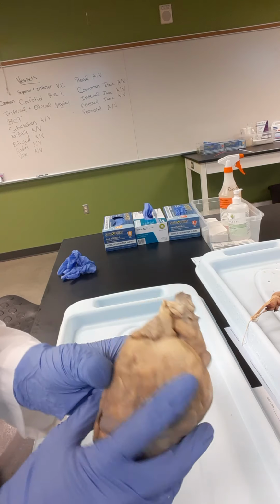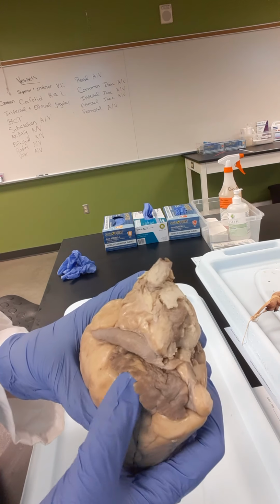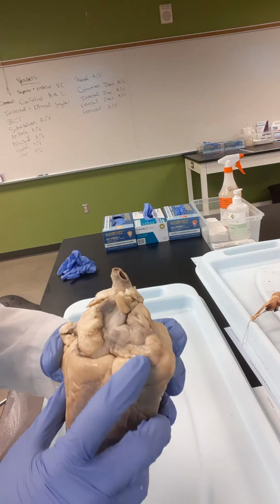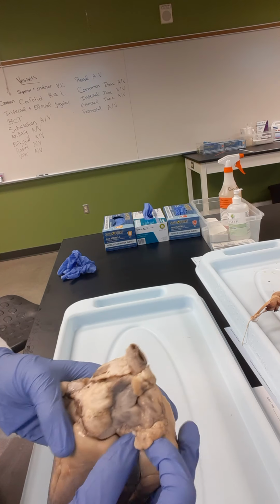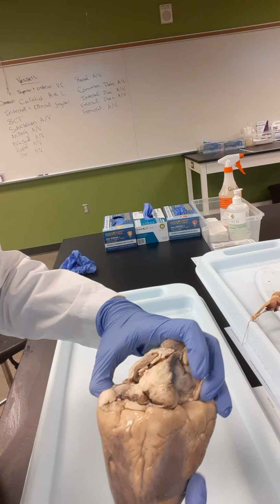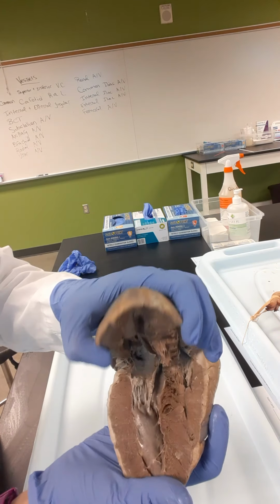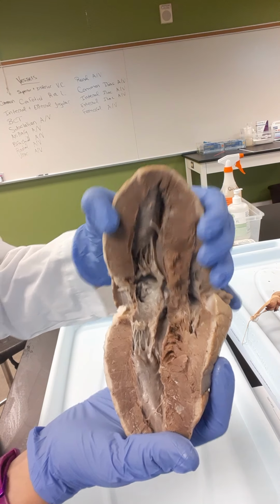When you are dissecting the heart, you have to find the auricles. And the auricles look like these kind of cauliflower textured darker pieces on the base. So these are these guys right here. Again, cauliflower texture, they can kind of lift off of the heart. And what you're gonna do is create an incision from the middle of one auricle to the middle of another auricle. And that will allow you to kind of open up the heart like a Pac-Man, right?